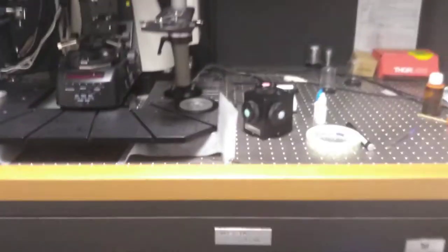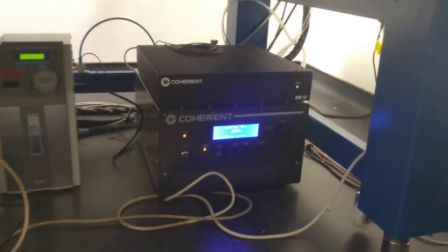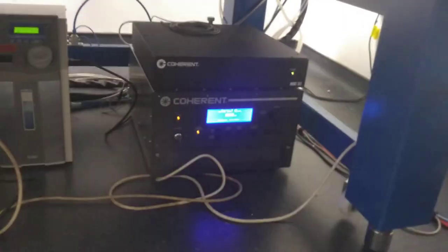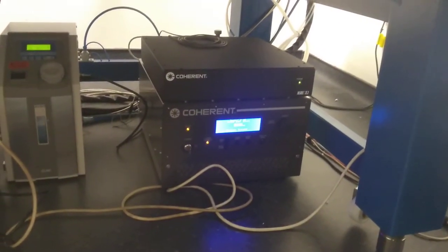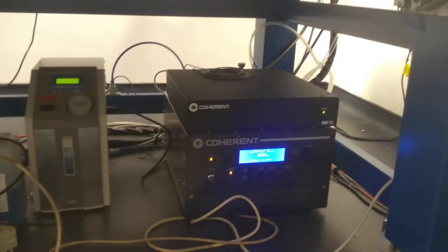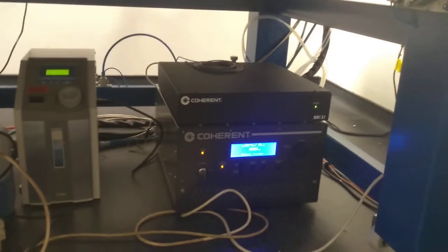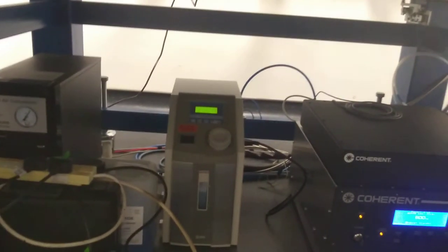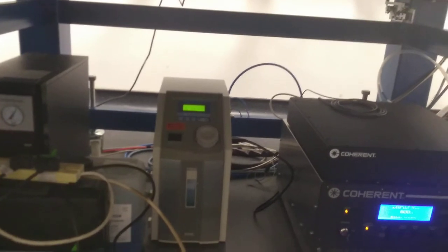You then need to decide which components to turn on. The first choice is whether or not to turn on the multi-photon laser, which is found under the table. If you are not using this, you do not need to turn it on. In order to turn it on, you only need to turn on the key on the front, checking that the cooler is active and normal first.